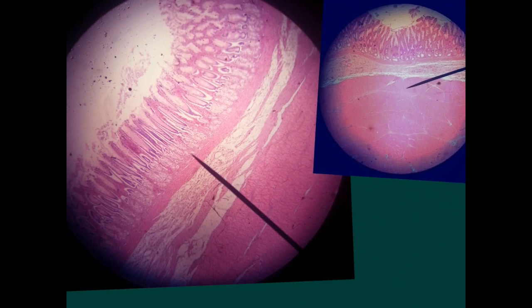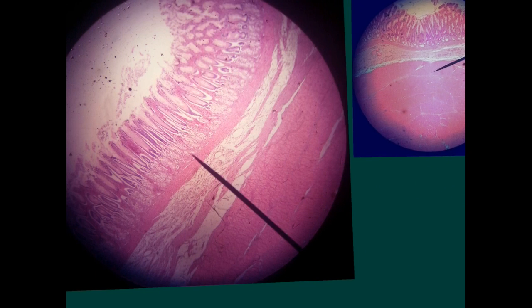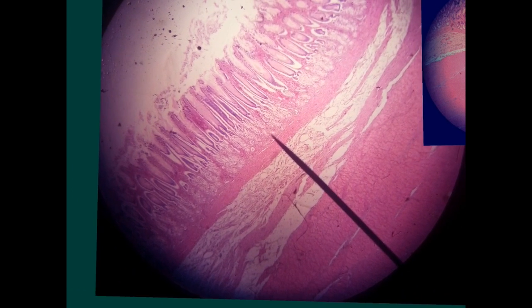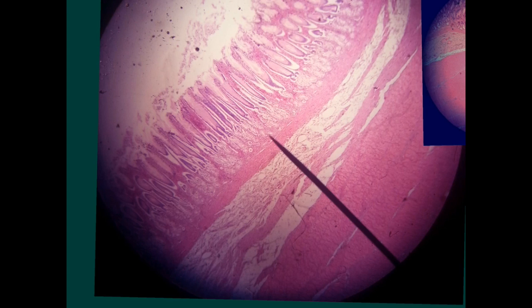Again, we will see the other picture here in more detail. Here you will notice, this is a picture of your slide under the microscope. You will notice what I have said as regards the straight mucosa. The pits can be seen individually, the ratio between the pit and the mucosa, and the appearance of these mucus acini, which are transversely cut deep parts of the glands. So this is the pylorus.